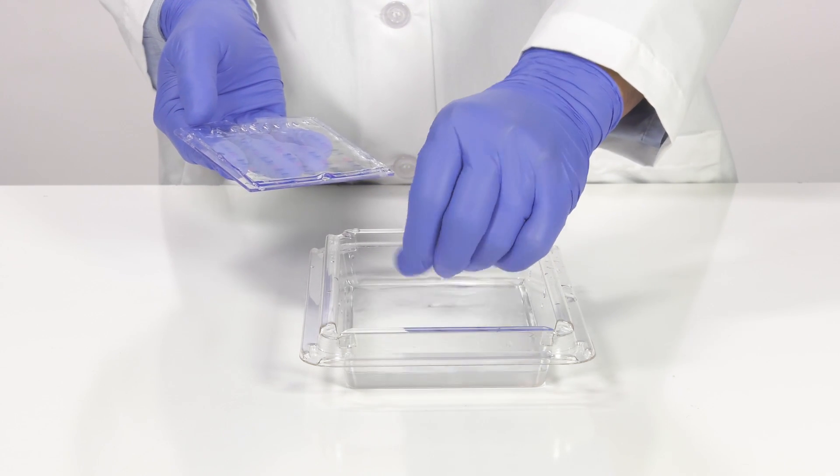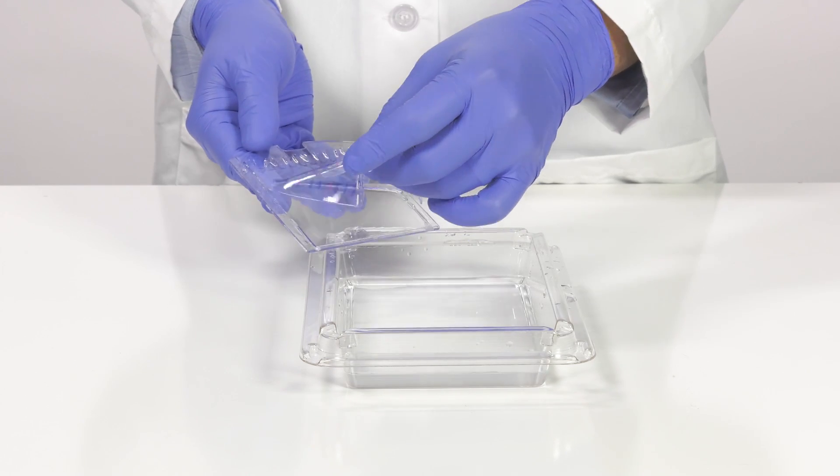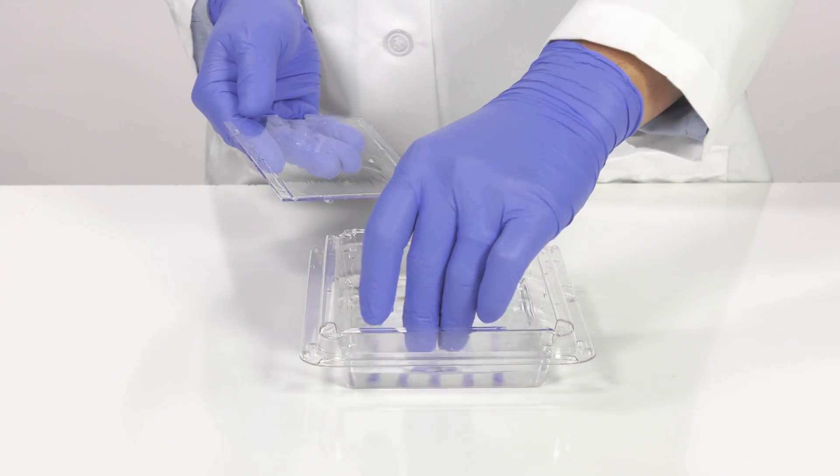Alternatively, slightly wet your gloves with buffer to minimize sticking and ripping. Then gently pick up the gel from the bottom and place it in a buffer filled tray.